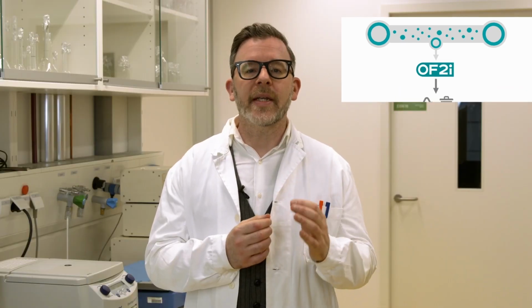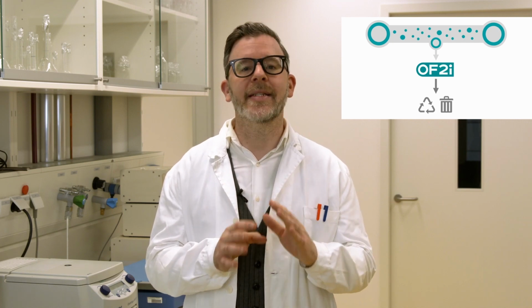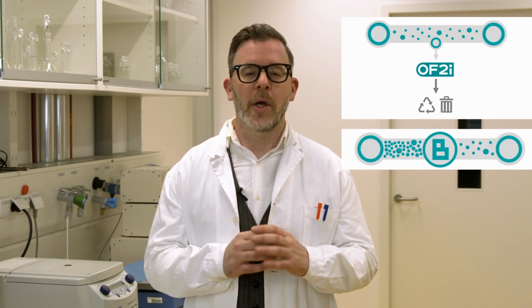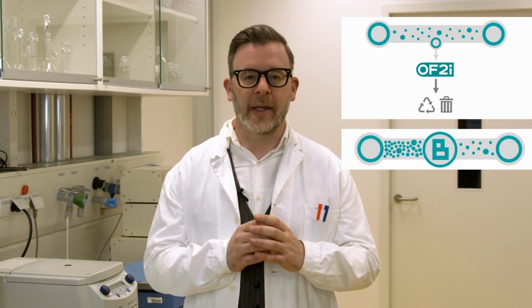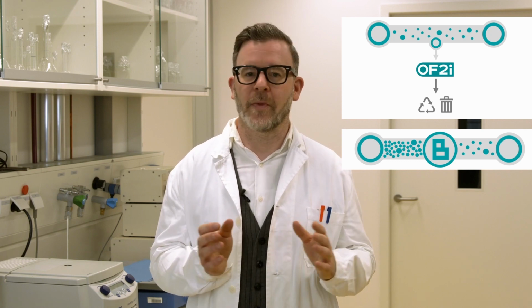There are basically 2 to 3 things needed from you. A sample withdrawal point within your production process. The bypass sample flow rate shall be in the range of 1 milliliter per minute, but can go down to tens of microliters per minute for valuable samples. A waste connection or sample collection, and thirdly, and just in case, to obtain single particle accuracy, your sample might need sample dilution. But no worries, this is done automatically. You provide the dilution media connection, the Brave B1 does the rest.